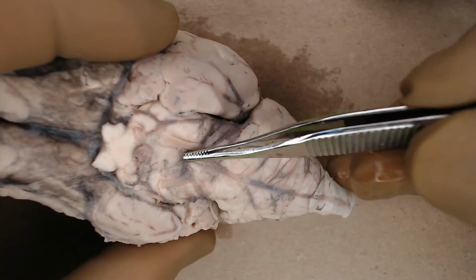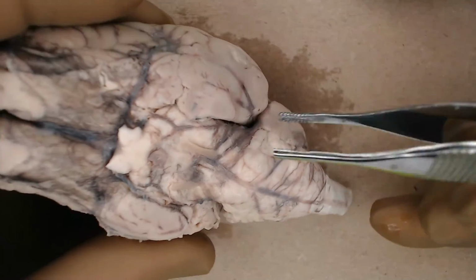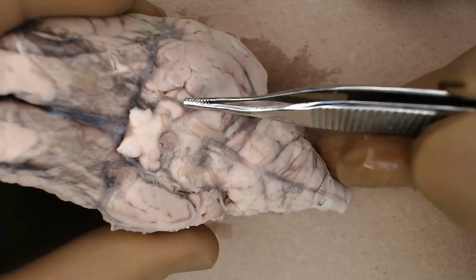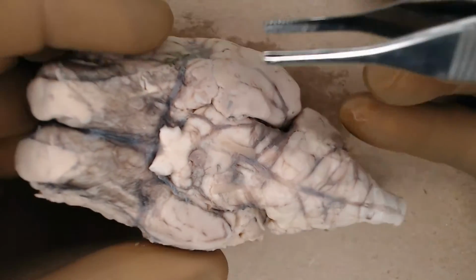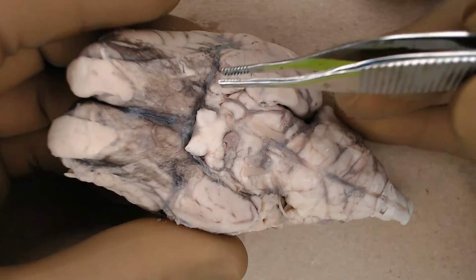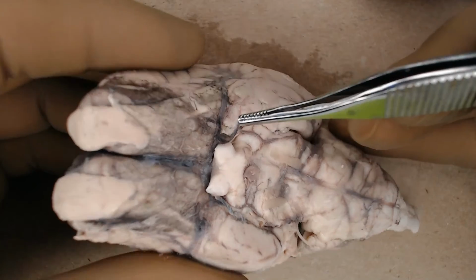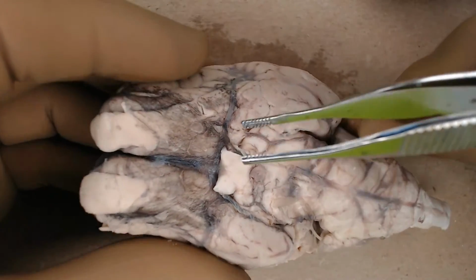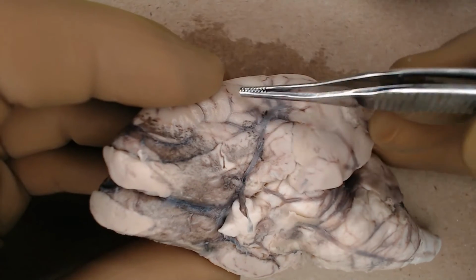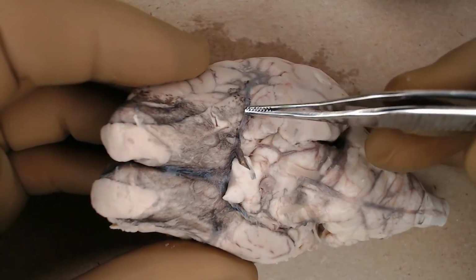So the basilar artery splits here into right and left posterior cerebrals. And then this arrangement here are the communicating arteries. And if you can find your incoming internal carotid, on this brain, it's right here. Okay. And the bulk of the blood supply from that would continue on as the middle cerebral, going between the frontal lobe and the temporal lobe here. So this is middle cerebral.